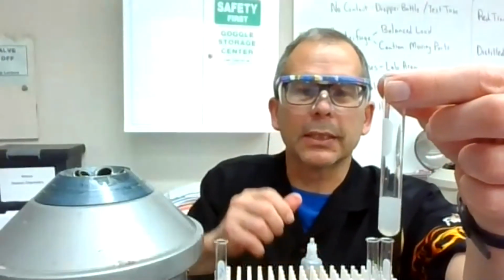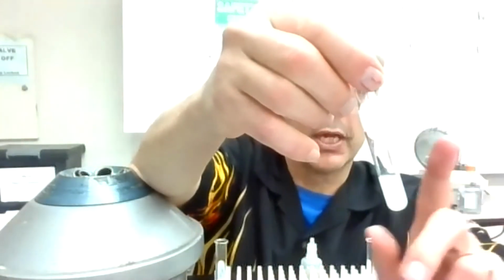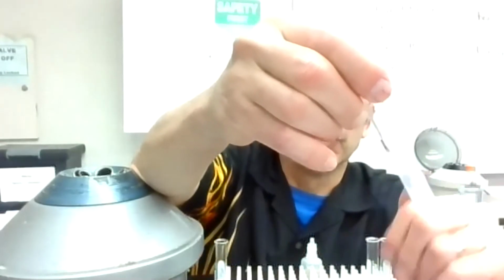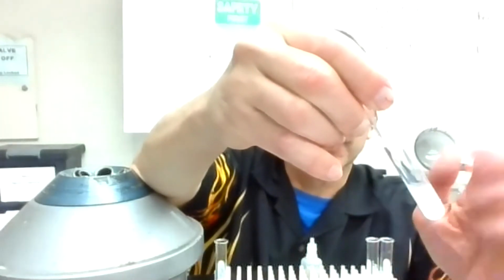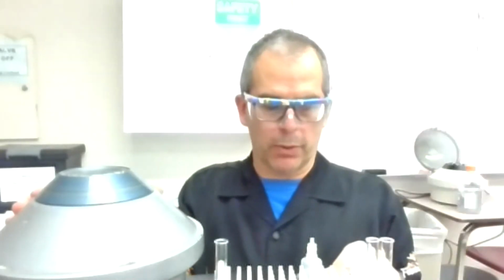Okay, so to me, it's hazy, but it looks like it was getting significantly more cloudy as I added the drops, which would be a sign of precipitate formation. So again, I'm going to put this into our centrifuge and give that a spin. I like to mix it good. And again, sometimes the centrifuge separates it, sometimes not. So then you have to remix and try again. Hopefully that's going to spin it so it separates pretty well.